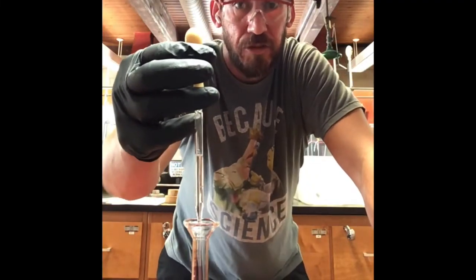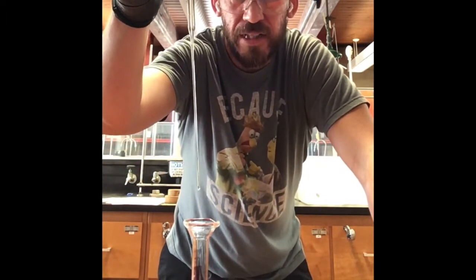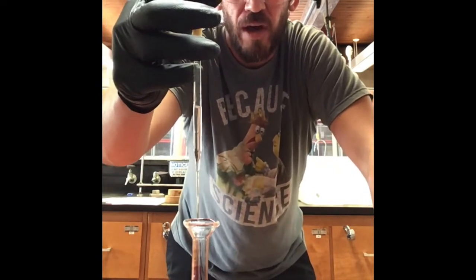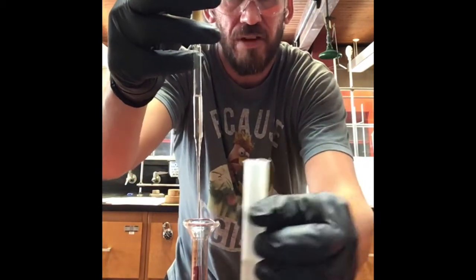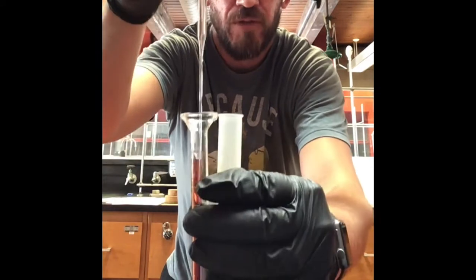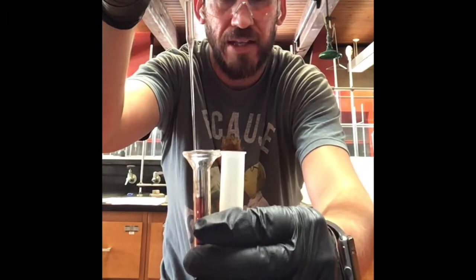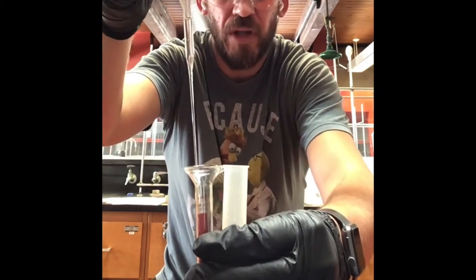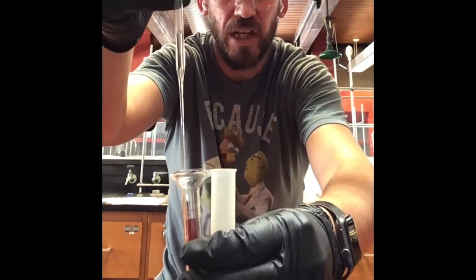Now, the methylene chloride has a tendency to jump out of pipettes when you move them around. You can see that it's dripping here. It's got a high vapor pressure. It's really dense. And so you have to be really careful when you're working with it because you don't want to drip it on you, right? So you can either have it really close to minimize the distance that you have to travel with the pipette, so therefore minimizing the amount of dripping on the benchtop or whatever. Or you can also hold it with one hand to put them right next to each other.